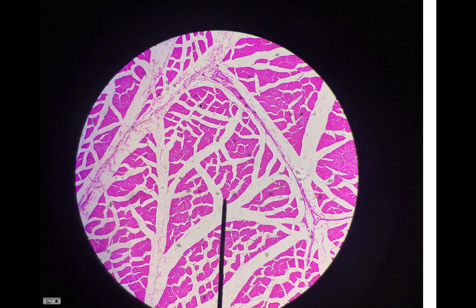Normally there's not that much space in between our muscle fibers. Here you can see the endomysium looks a little bit better. And then we're going to have our perimysium that is making a fascicle. So here's a fascicle here. This would probably be a fascicle here.